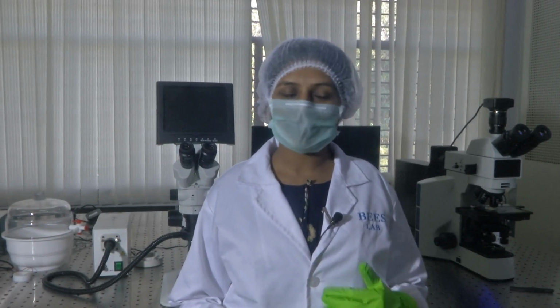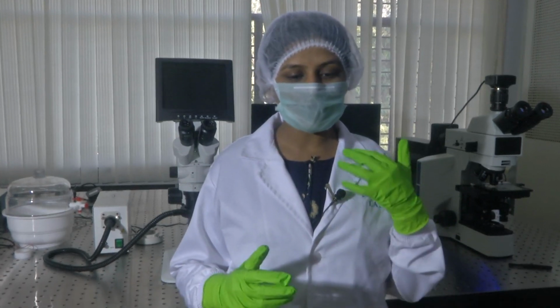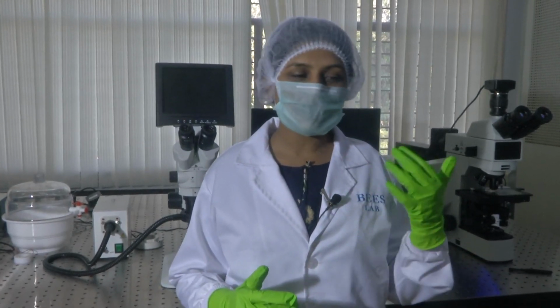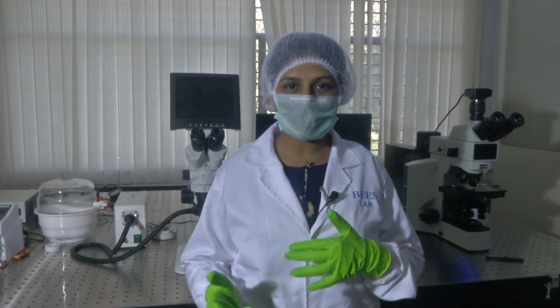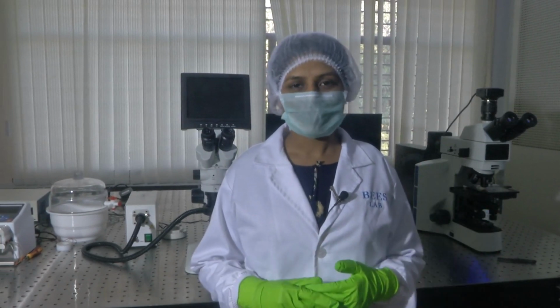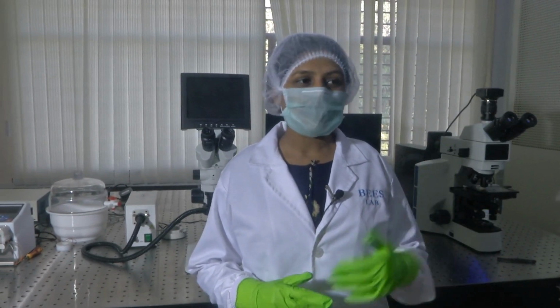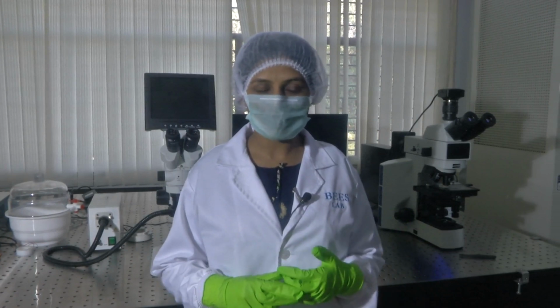Today I am here in the clean room facility detailing the type of microscope, the choice of microscope, which is required while you work in an environment where you do microfabrication, integrate biology and micromachining techniques. So, let us start with the cell and tissue culture techniques, which were detailed to you by Professor Hardik in one of the course modules.